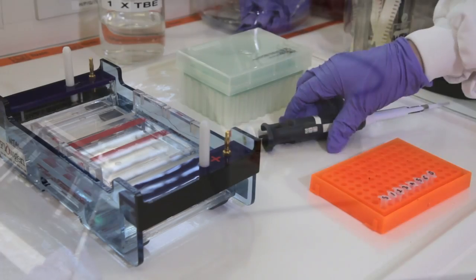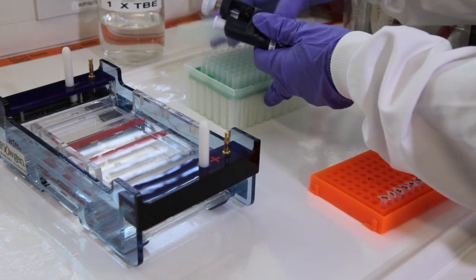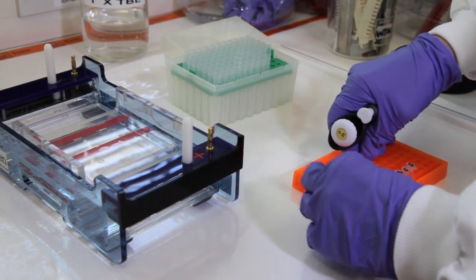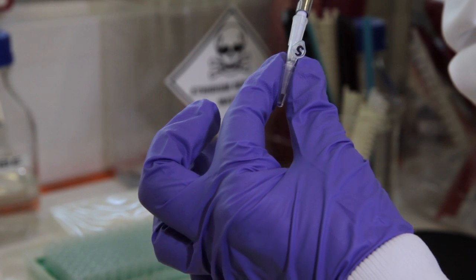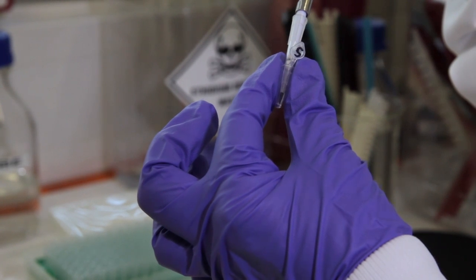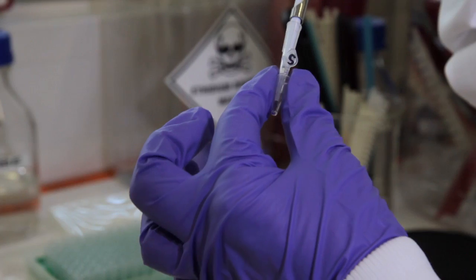Today we are going to use 1 microliter of loading buffer and 3 microliters of PCR product. For each of the samples combine the dye and PCR product in a tube. Vortex and spin down or just carefully pipette up and down, it's just as good.